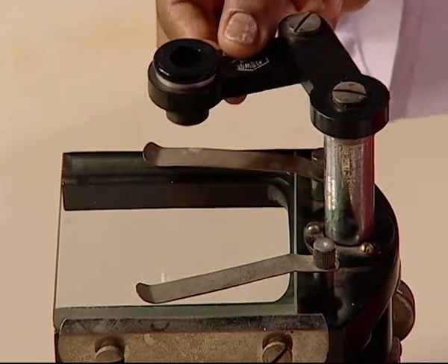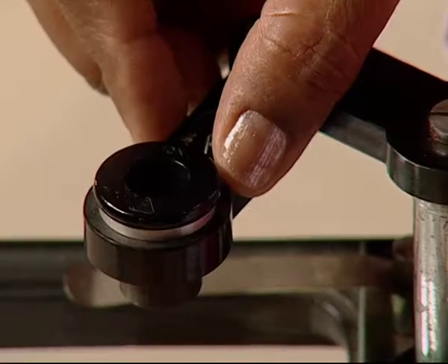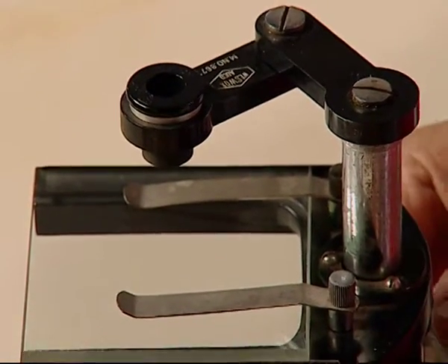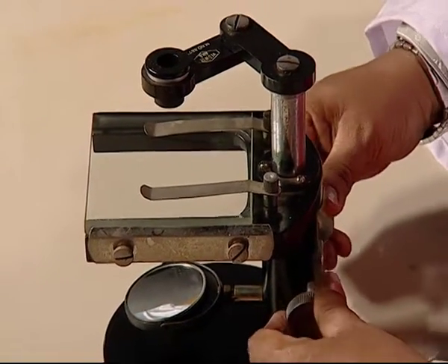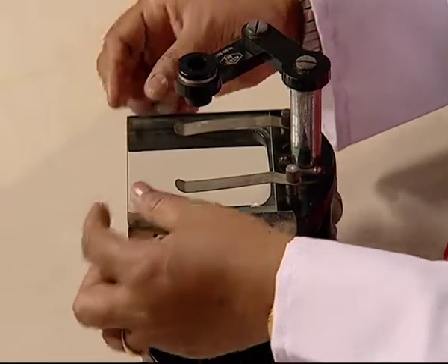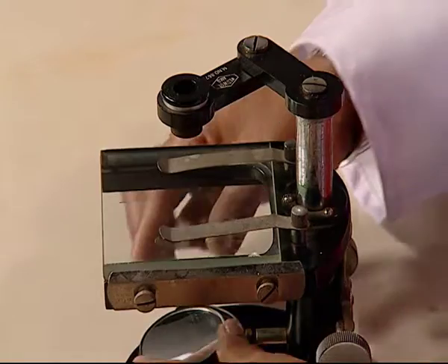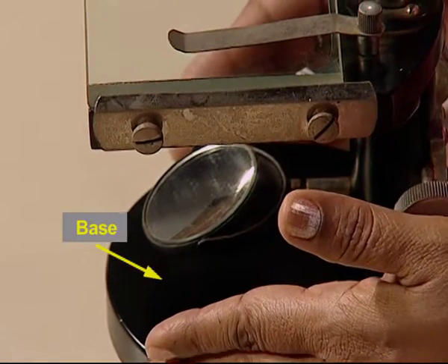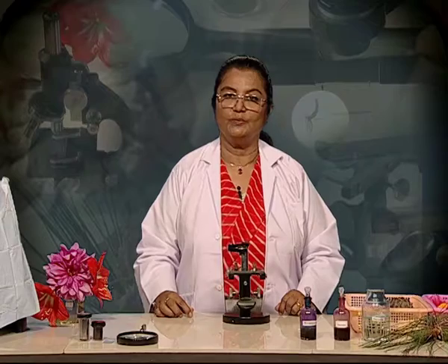Next, we can see a folding arm. It has a folding arm to position the lens right above the object. Then there are the adjustment knobs to move the lens up and down for focusing. There is a stage made up of glass, 2 clips on the stage, a reflecting mirror and the base. Let us see now how to use a dissecting microscope.